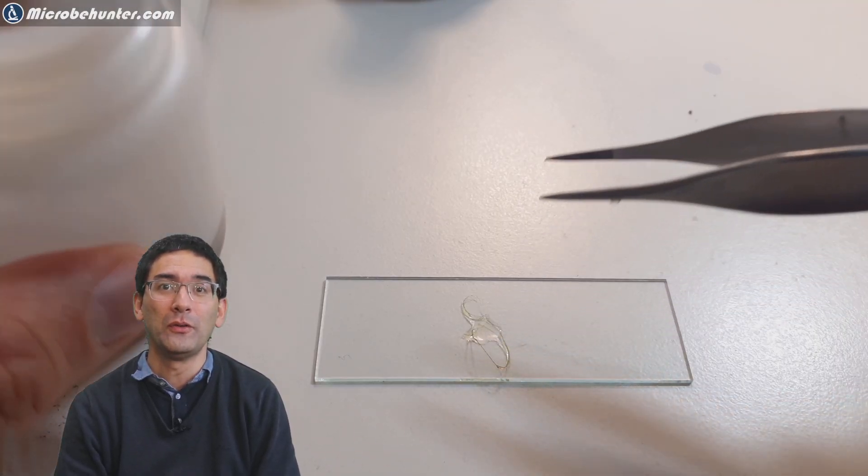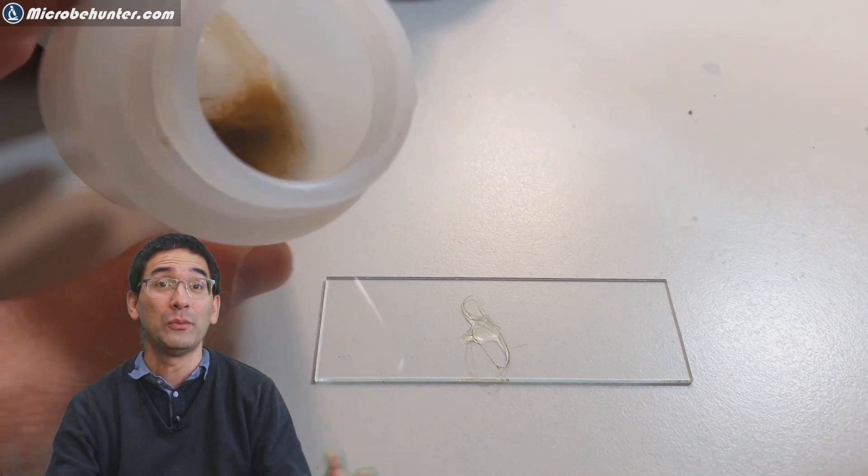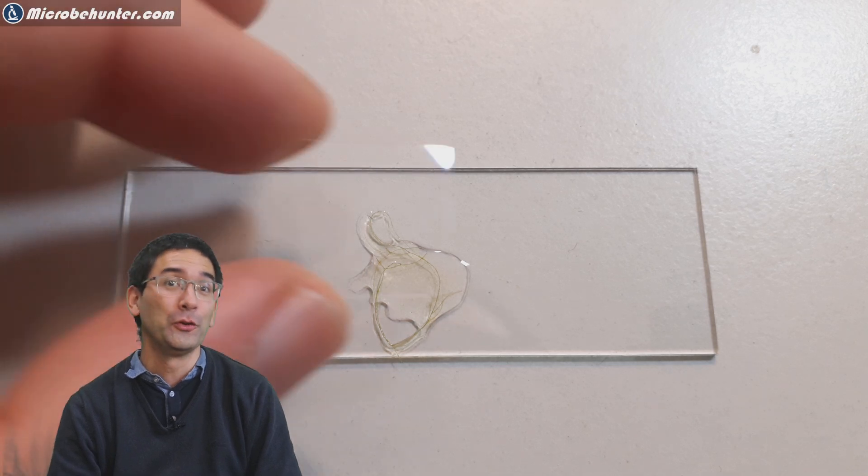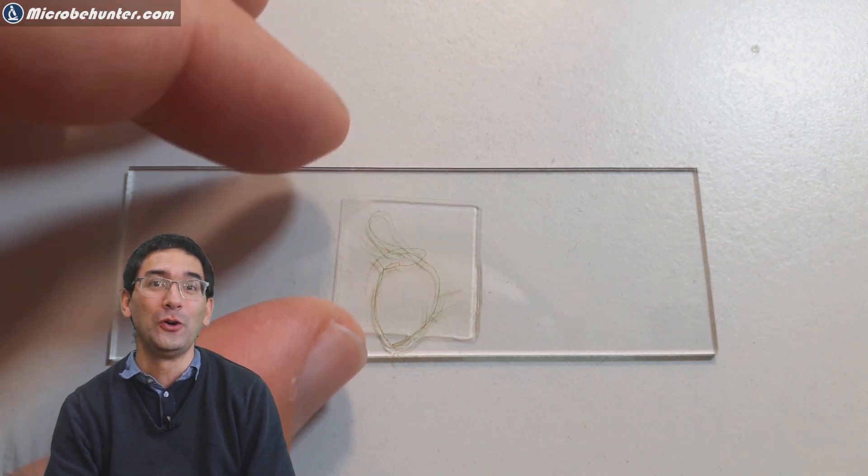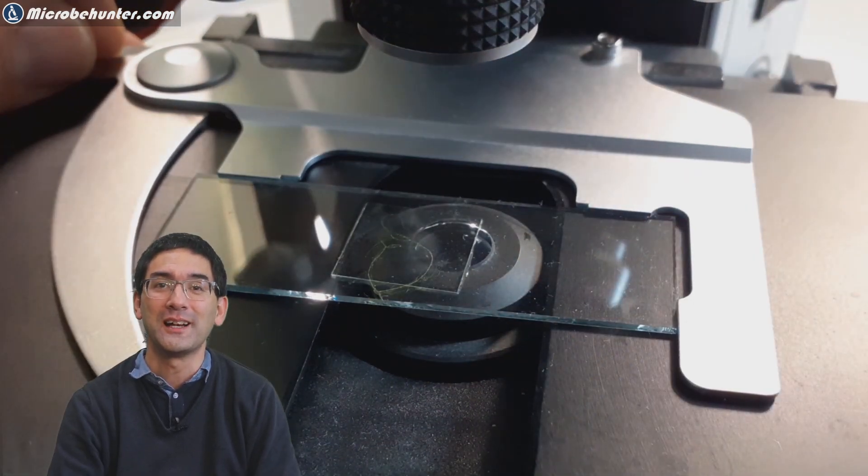Back at home, I took a small sample of this and put it on a microscope slide. Cover glass goes on top. I was actually kind of wondering what I can find, and I was not disappointed to see that there were indeed a lot of algae and of course also diatoms. I'm just going to show this to you in a second when I'm finished preparing the slide.